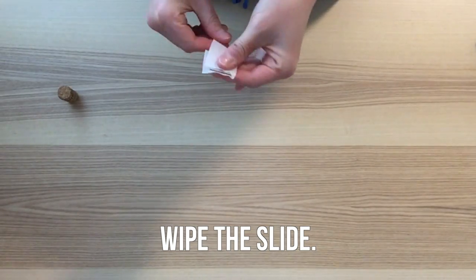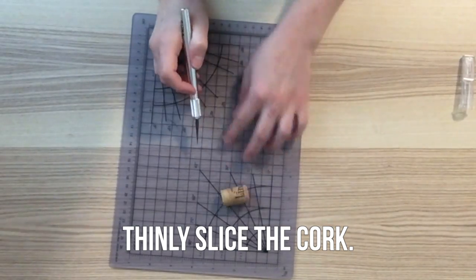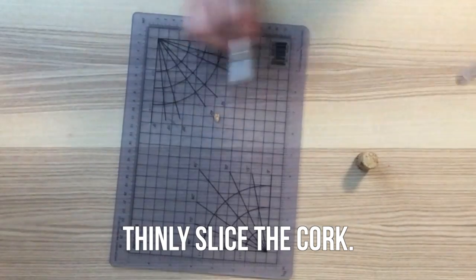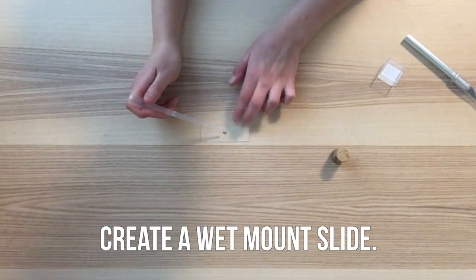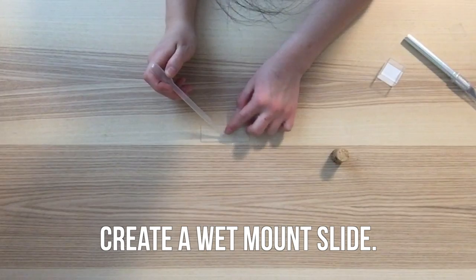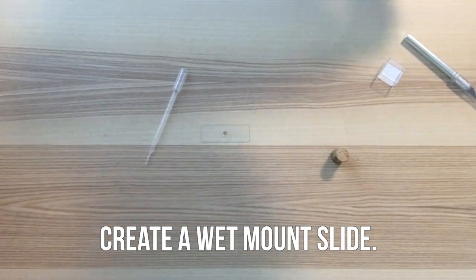Start by wiping the slide using an alcohol wipe. Then thinly slice the cork using an X-Acto blade. Next, create a wet mount slide by adding a drop of water on top of the cork and then carefully placing a cover slip on top.